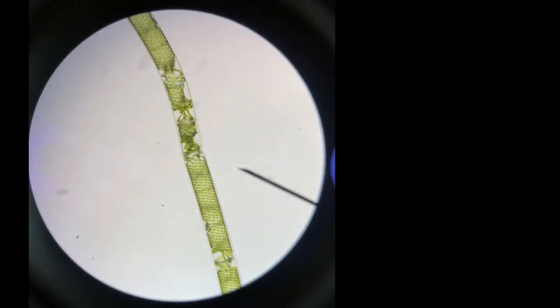Here is our algae specimen. Now, please draw the picture of algae observed with naked eye and under the microscope.